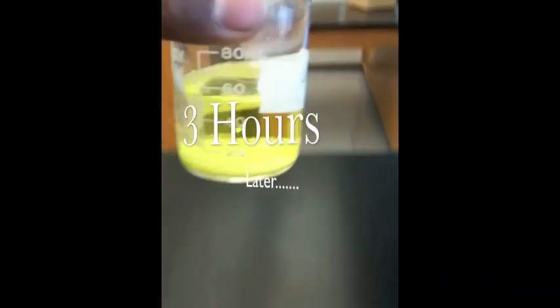As we take a zoom in, we realize that there is nothing but liquid. But after three hours, we looked at the bottom and we found precipitate, strontium chromate.